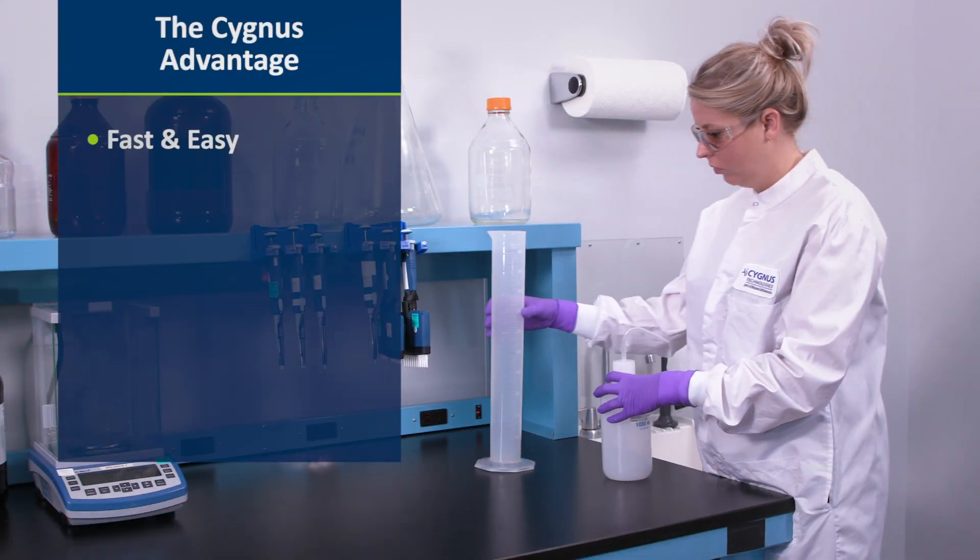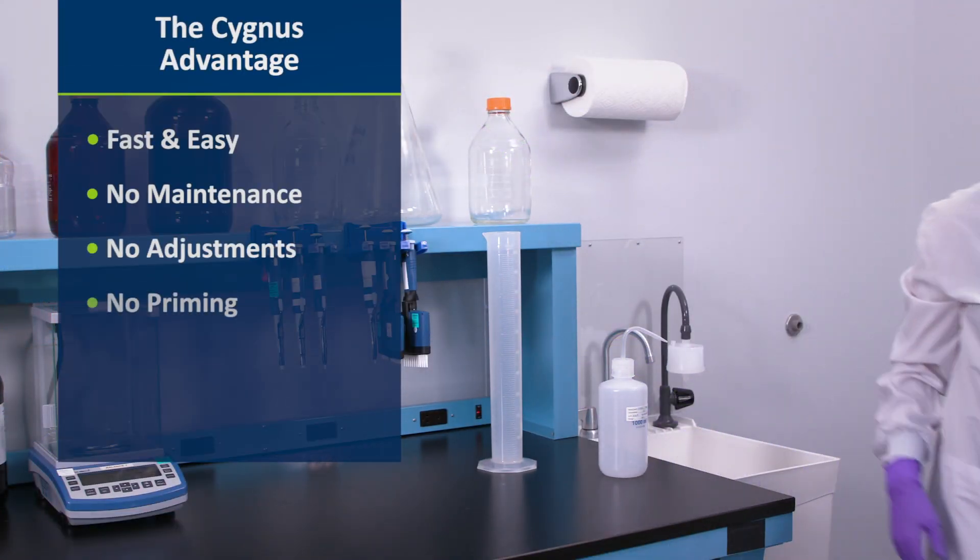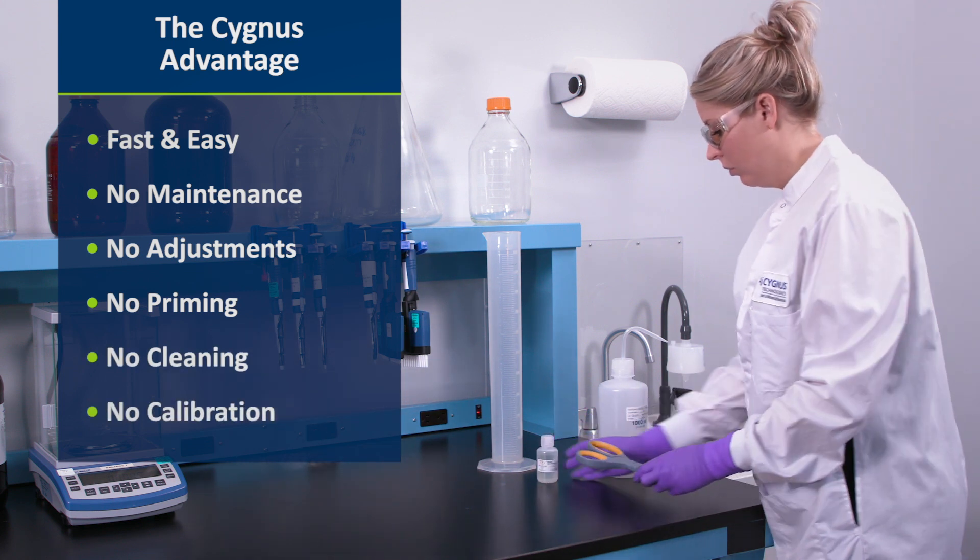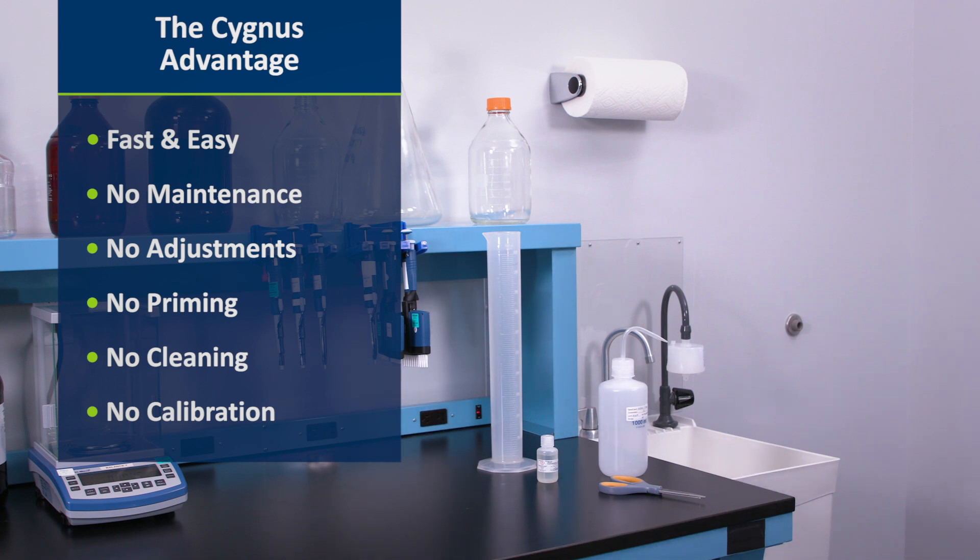Our approach is actually faster and less labor-intensive than automated systems that require constant maintenance, adjustments, priming, cleaning, and calibration.